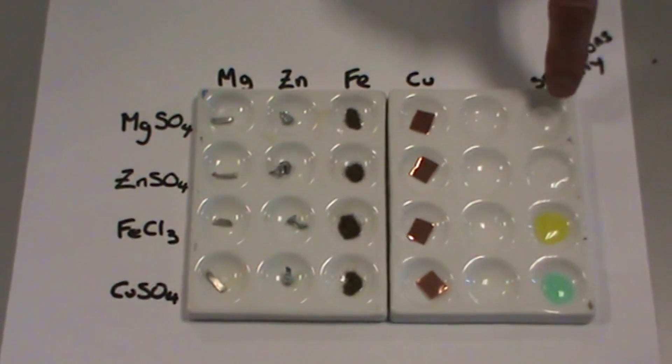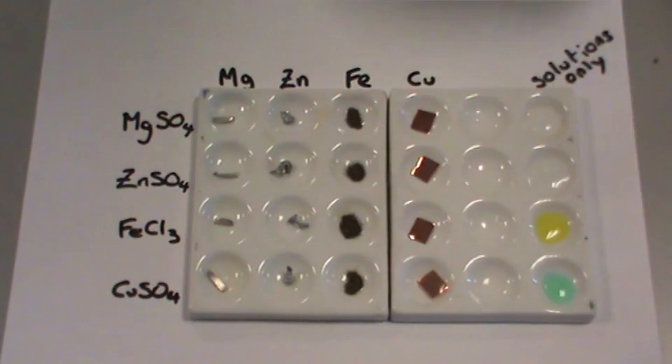These are the solutions: magnesium sulfate, zinc sulfate, iron chloride, and copper sulfate.